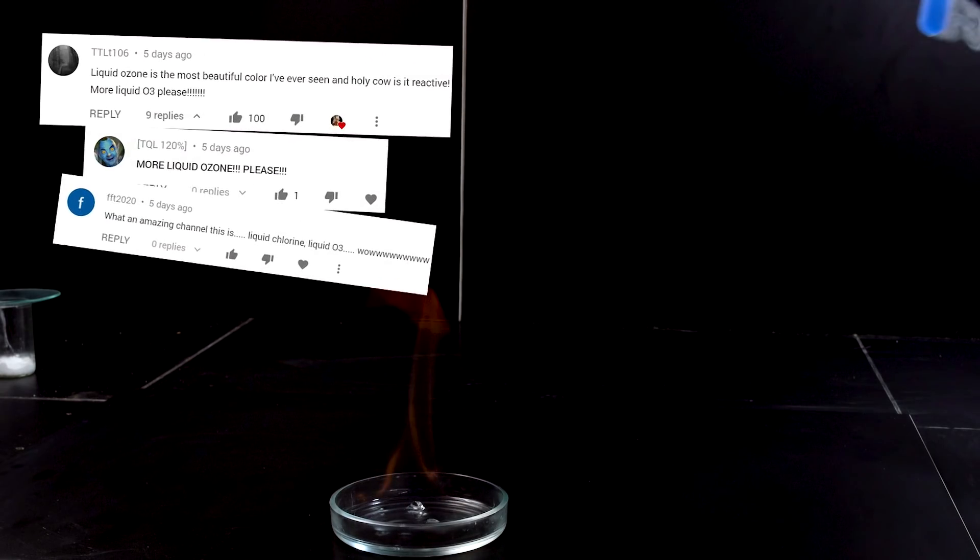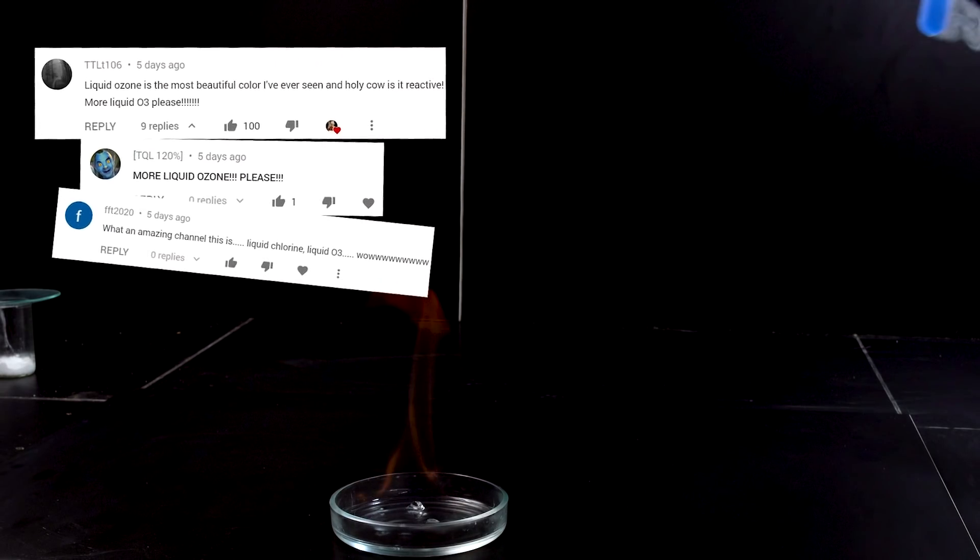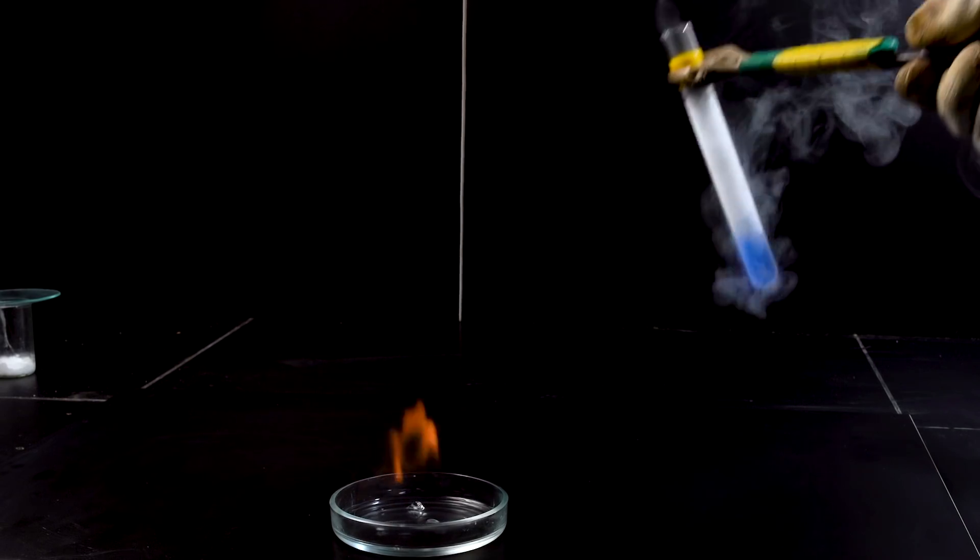Taking your likes and comments to the previous video into consideration, I am going to add some ozonated oxygen to dioxane.